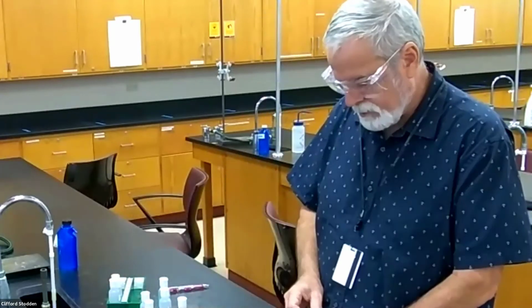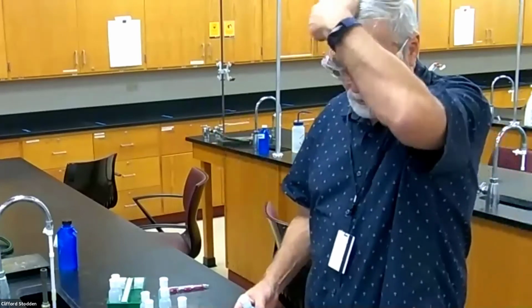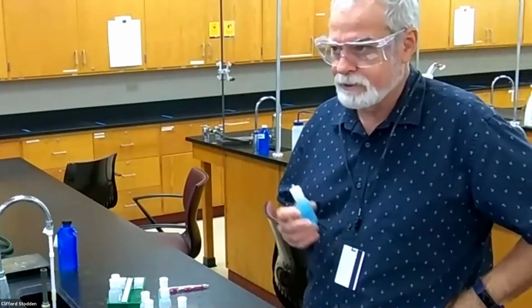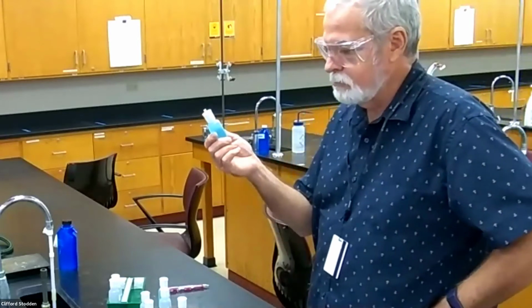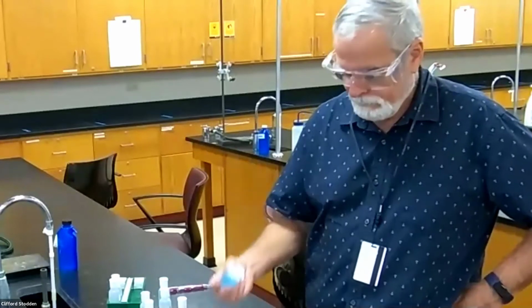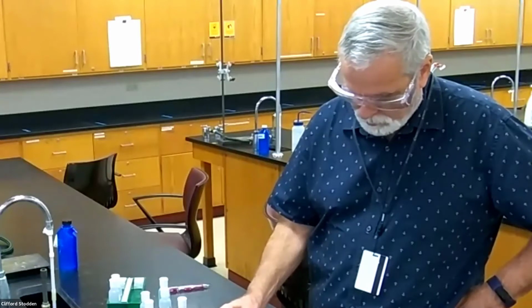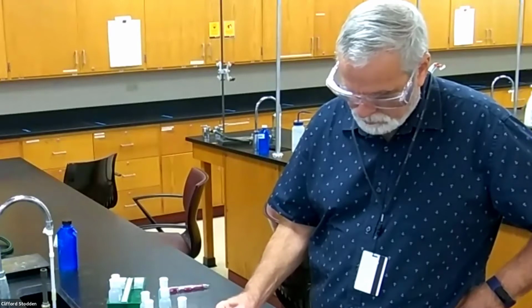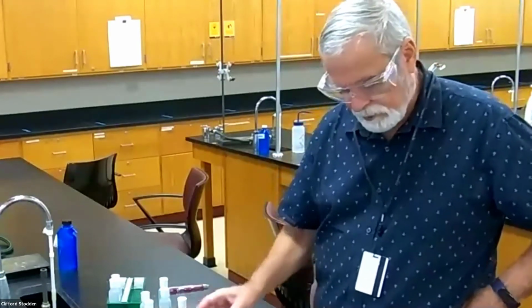So I'm not doing this to identify the copper because I can identify it immediately just with looking at it, but this may be helpful in identifying things I'm adding to the copper, because as soon as you guys start your experiment next week, you'll know which one is the copper because it's the blue one. Okay, so I'm going to put some copper in all of these, and all the way across, just to save some time. Okay, because I'm going to add several things to the copper.